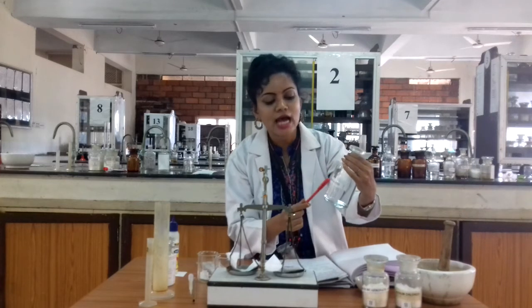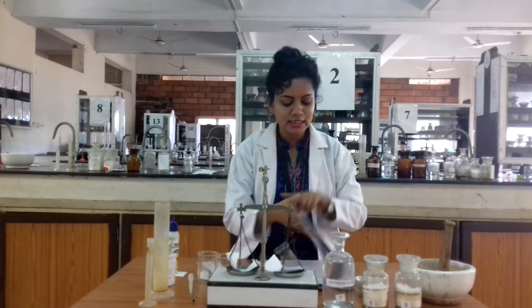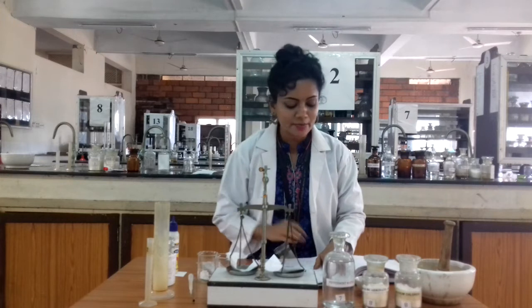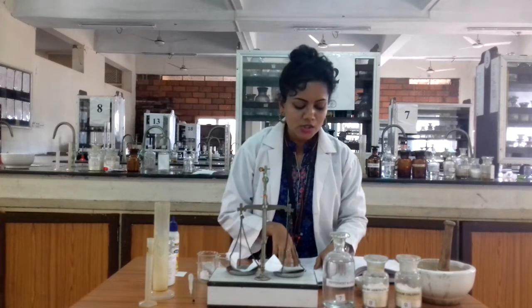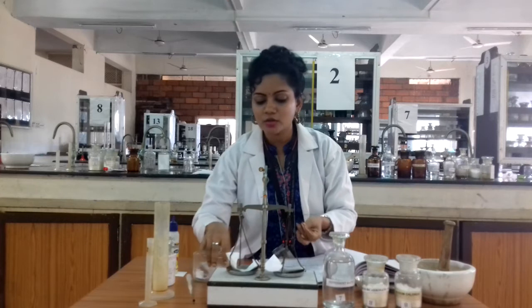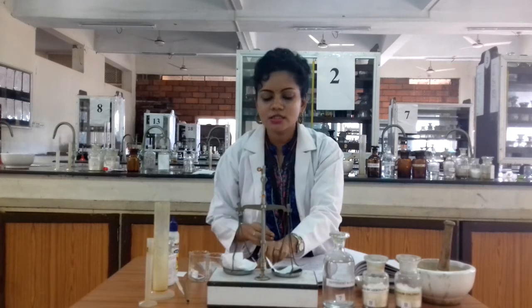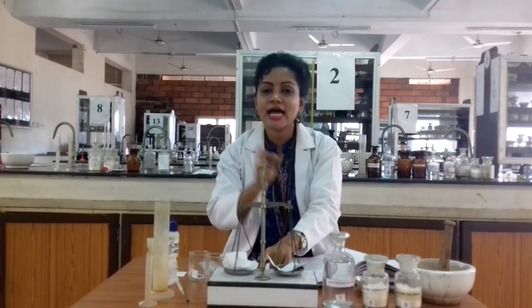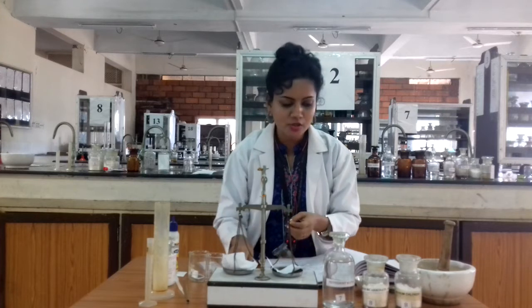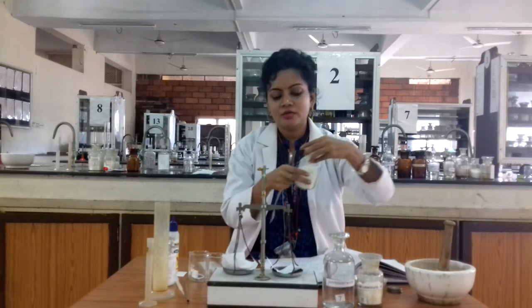Peppermint water acts as the vehicle and is a good flavoring agent in most of these preparations. So first you weigh out all the ingredients. Here I am going to prepare 50 mL of sodium chloride mouthwash, so we need 0.75 grams of sodium chloride. Before starting the preparation, check that the balance is in equilibrium — the center needle must be at equal distances from left to right.